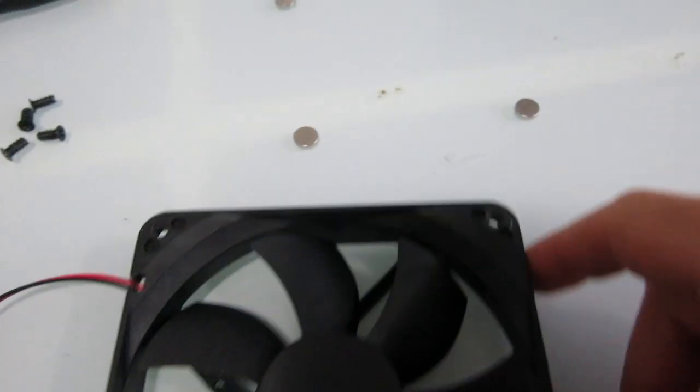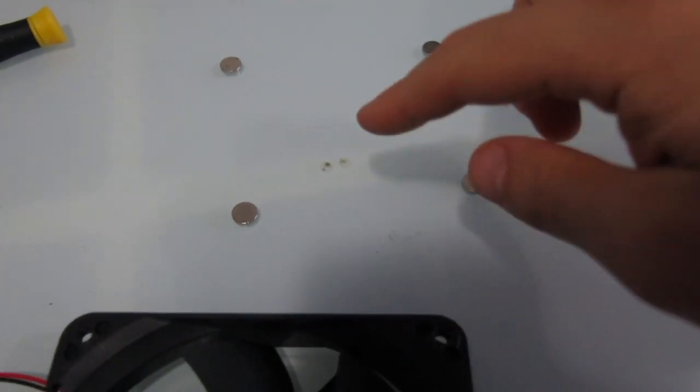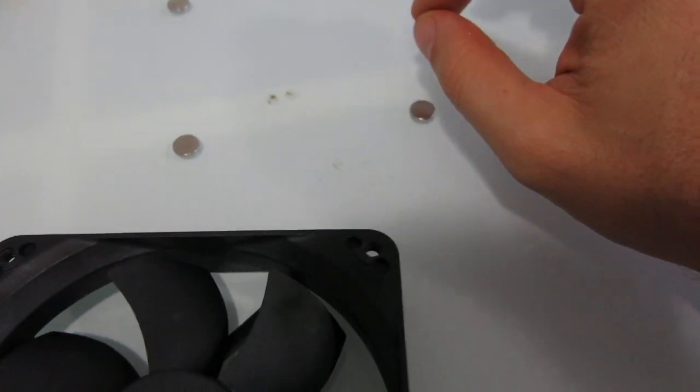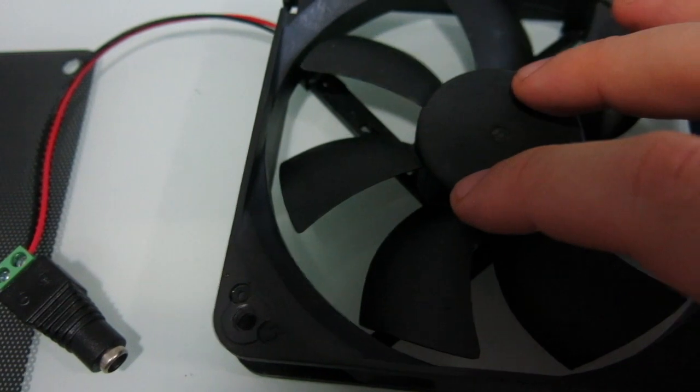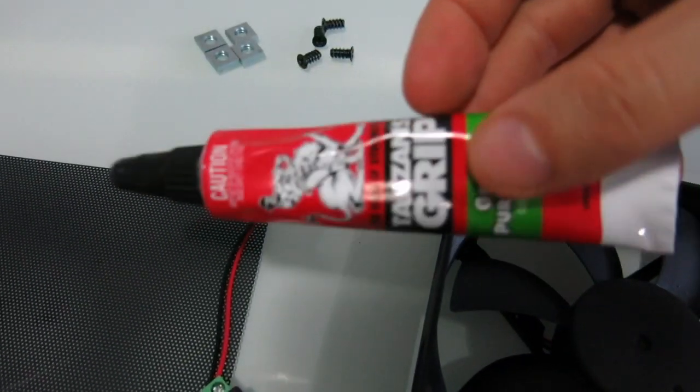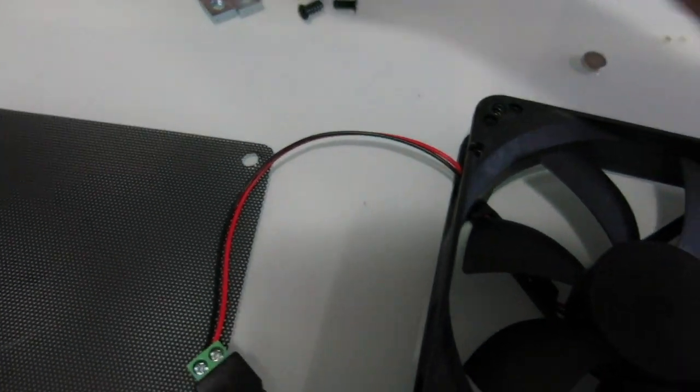And the reason why these four things are separated is because they're rare earth magnets, so they're really strong, and I'll be gluing them at evenly spaced points on the fan with some general purpose Tarzan grip.